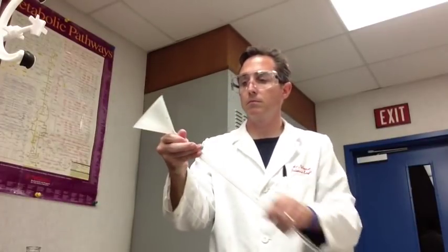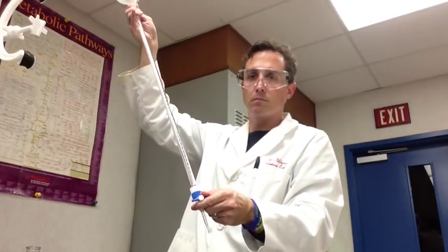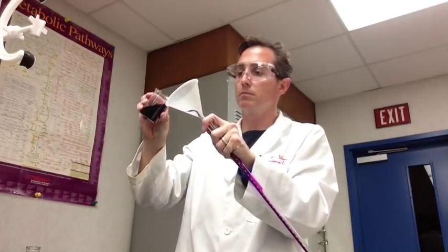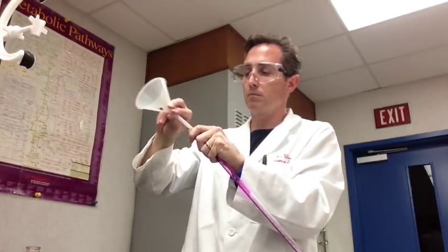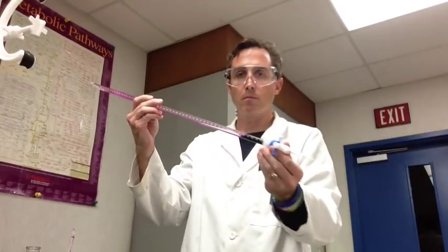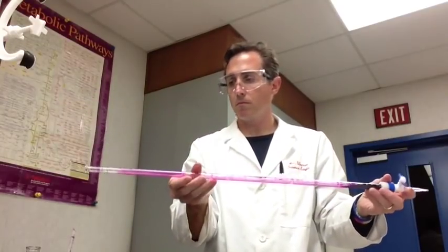Once you have that or once somebody's getting that stuff together in the flask someone else can be rinsing out the burette. Make sure that your stopcock is in the off position before you add the potassium permanganate so that it doesn't leak at the bottom. You're going to add just a few milliliters because you need to rinse it out. You're gonna have to do this three times.